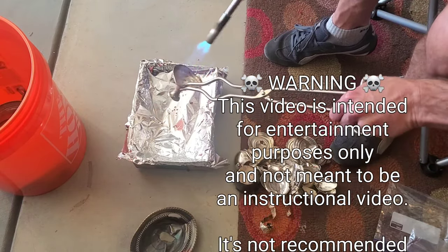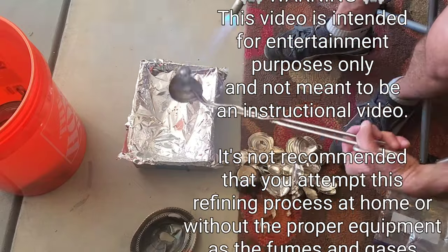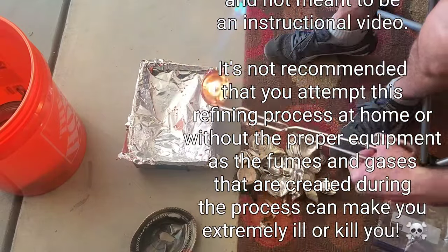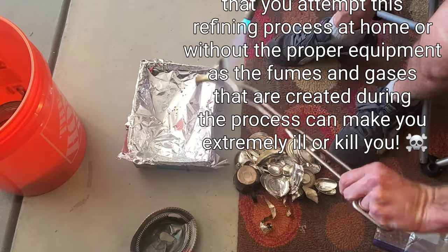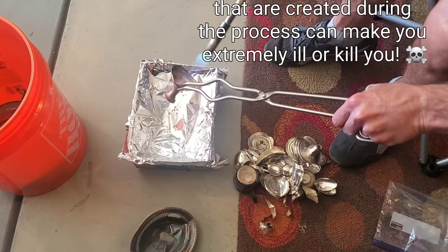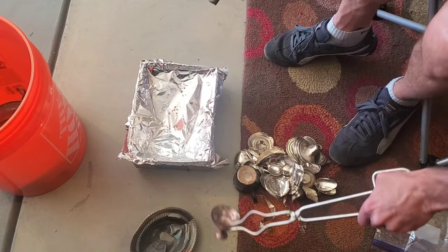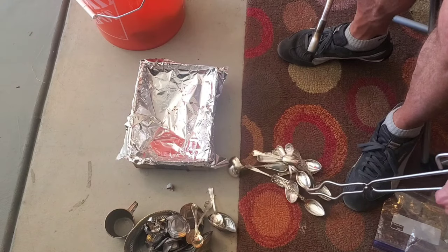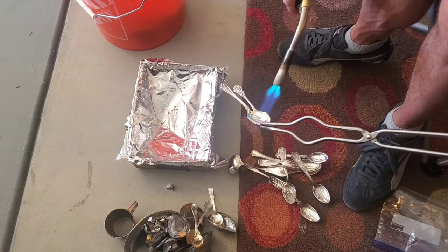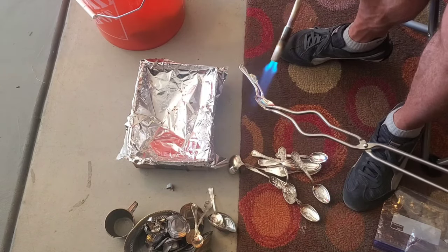All right in this video I'm going to refine this sterling silver which is 0.925 fine into 0.999 fine silver. The first step is to burn off any residues such as leftover wax, grease, or oils.